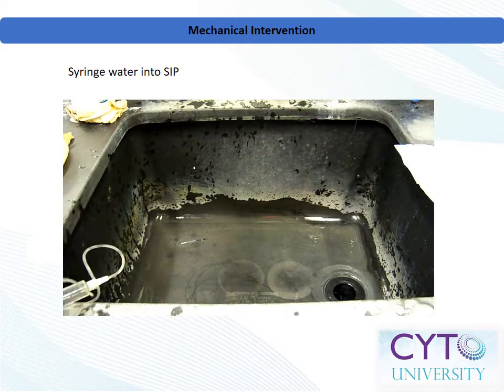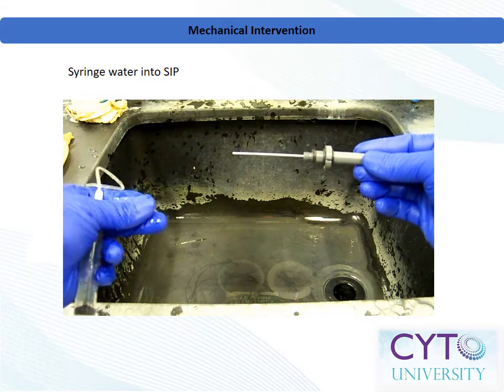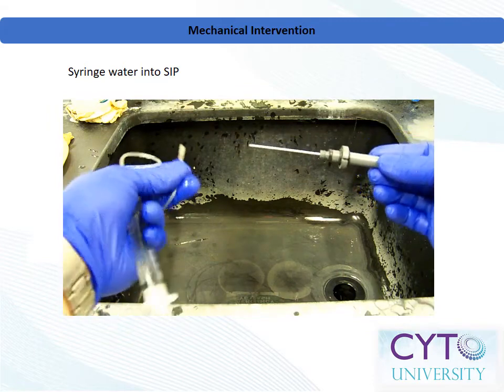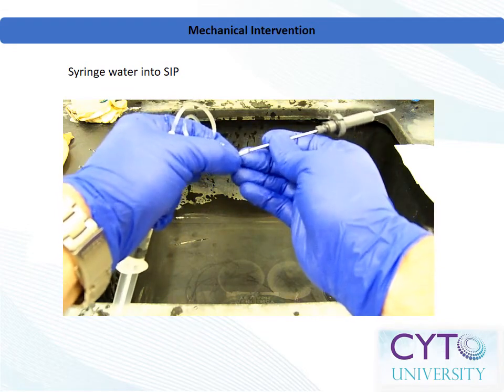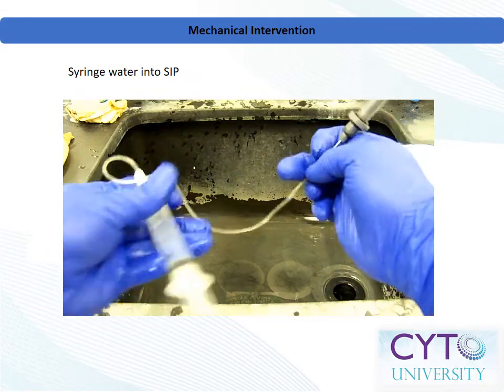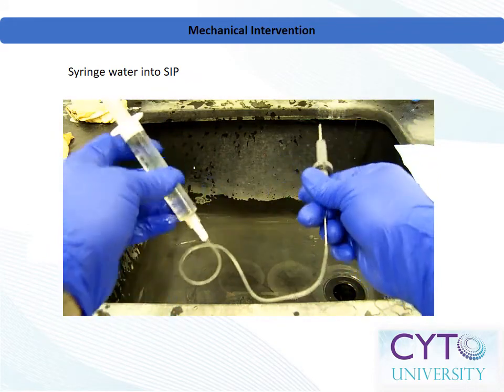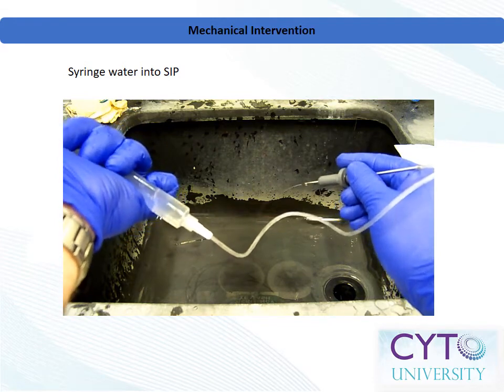As a second option, modify a butterfly syringe by cutting the tubing just above the needle. Then, push the flexible tubing onto the flat end of the inner sample injection tube. Fill the syringe with cleaning solution and connect it to the luer fitting of the butterfly's tubing. Depress the syringe plunger, forcing cleanser through the inner sample injection tube.